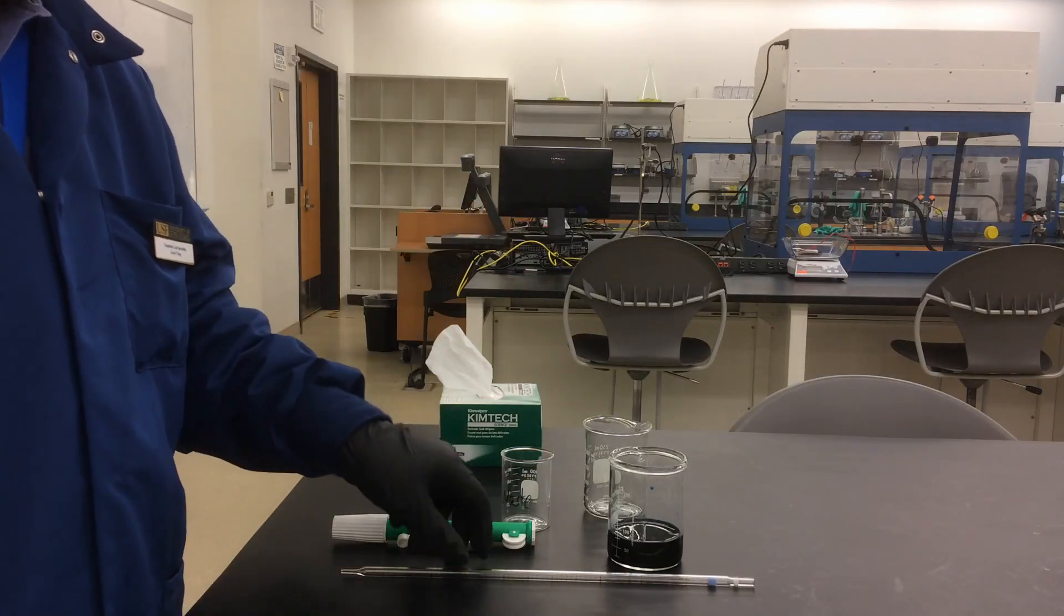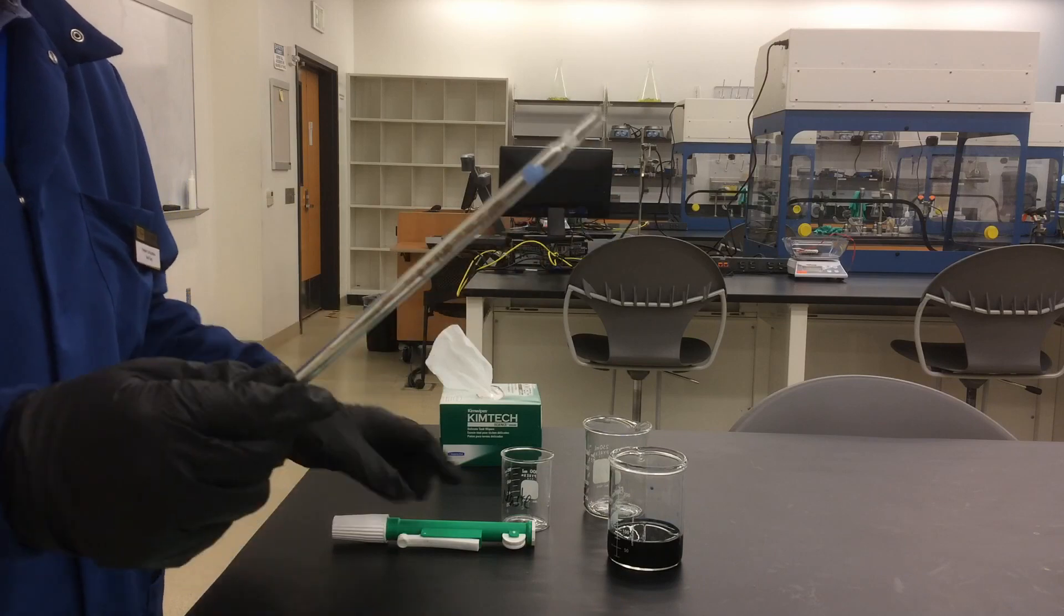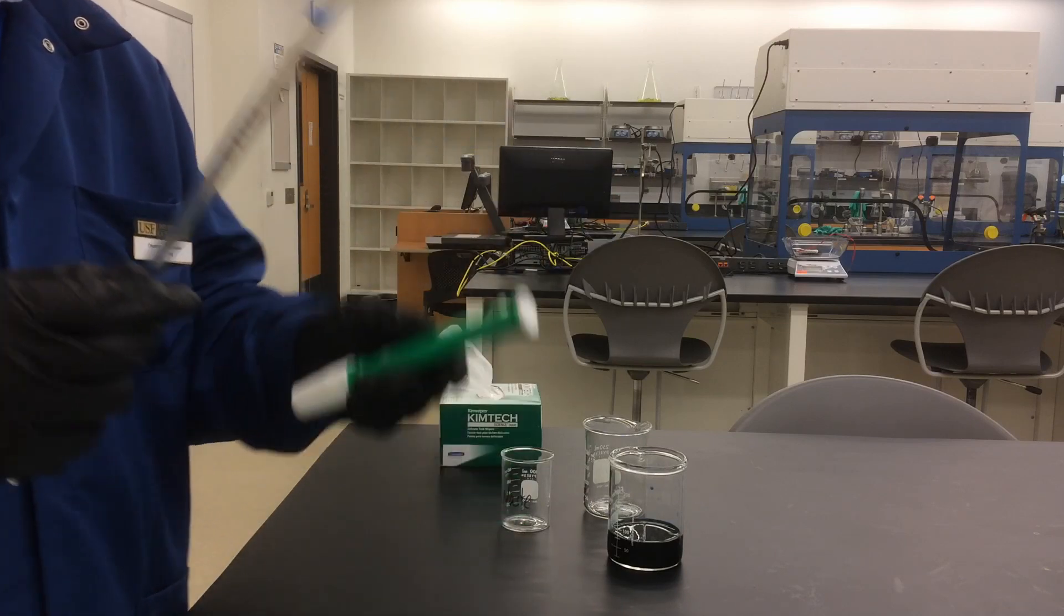Hi, today I'm going to show you how to use a graduated pipette to transfer liquid with a pipette pump.